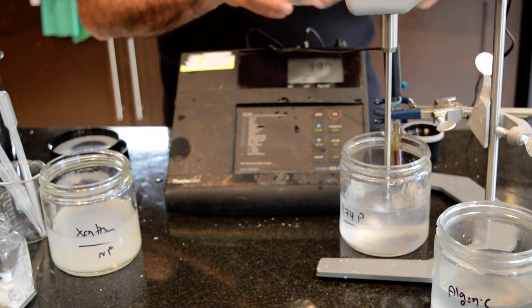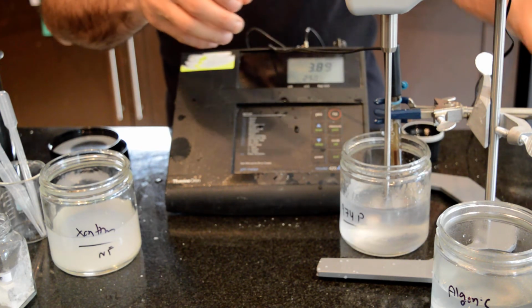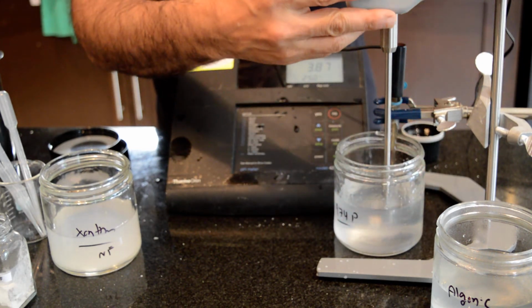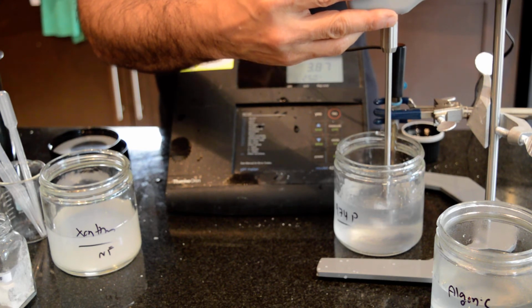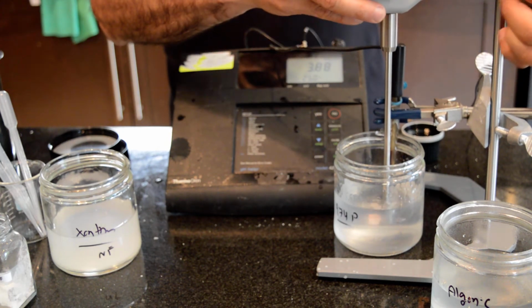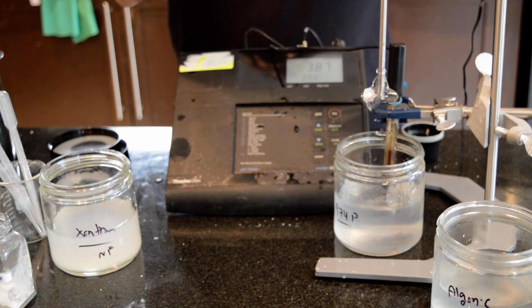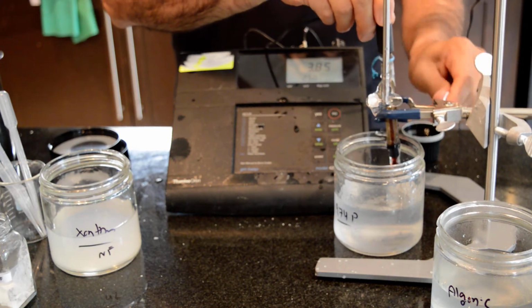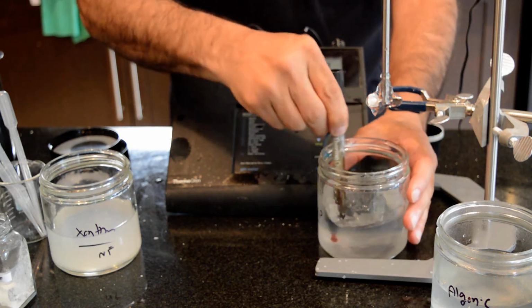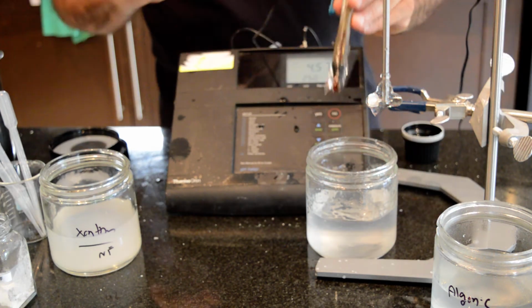So I think I'm going to stop this because this process seems to be very slow. I formed such a thick gel and I'm not getting the pH that I want. But for demonstration purposes, I think this is good enough. That shows that this stuff is a very gel-like material. And for the case of xanthan gum, I don't need to do any pH adjustment. You can see that my blade is all covered with gel, and also my electrode is all covered with gel. It's very thick stuff, kind of like a semi-solid even. So I have a lot of washing to do.